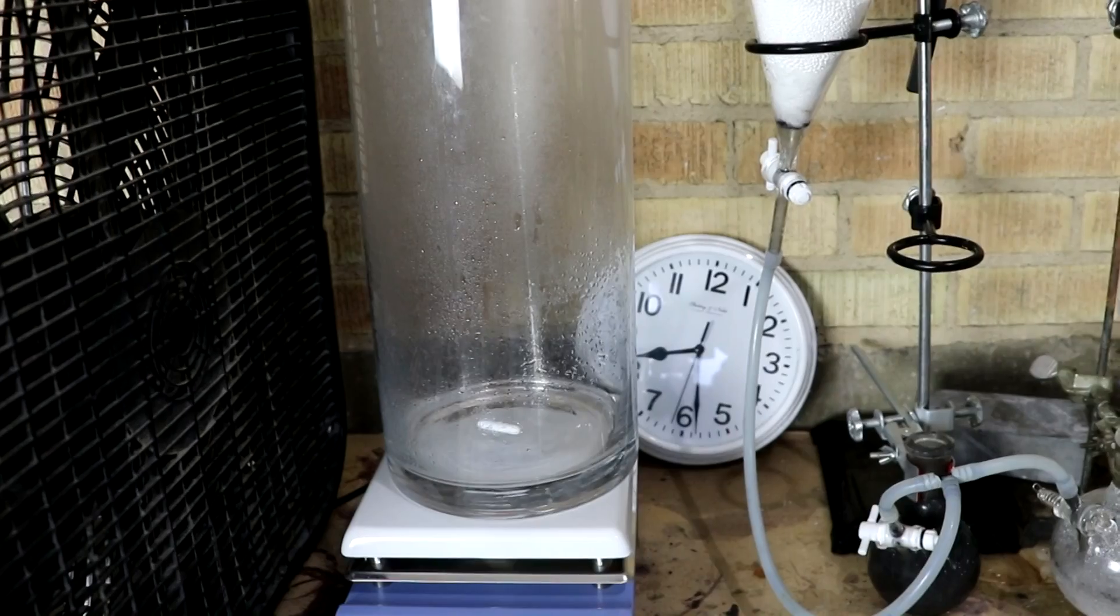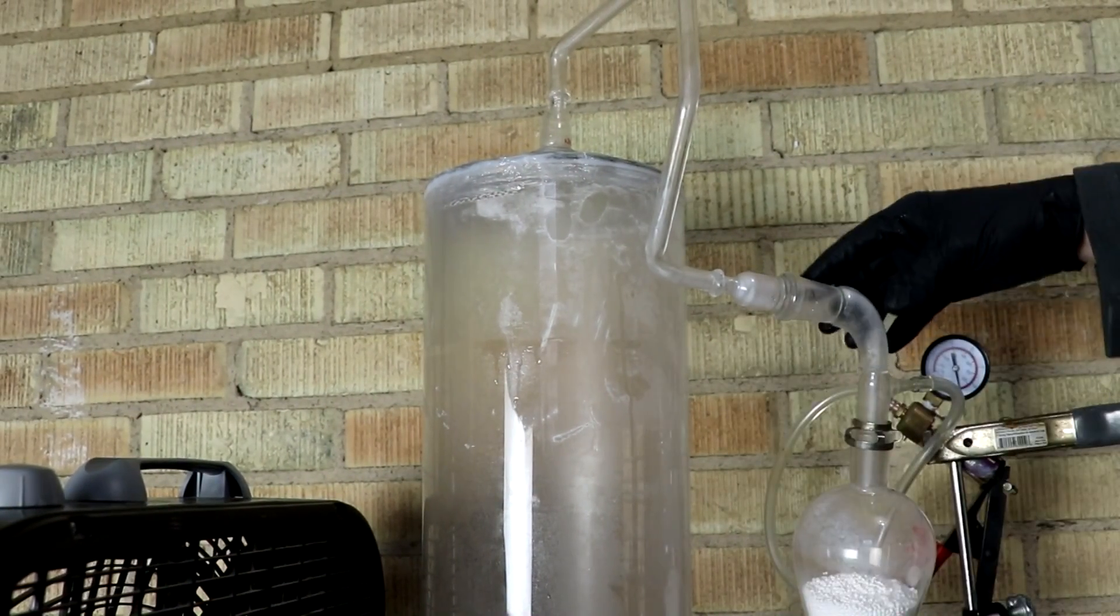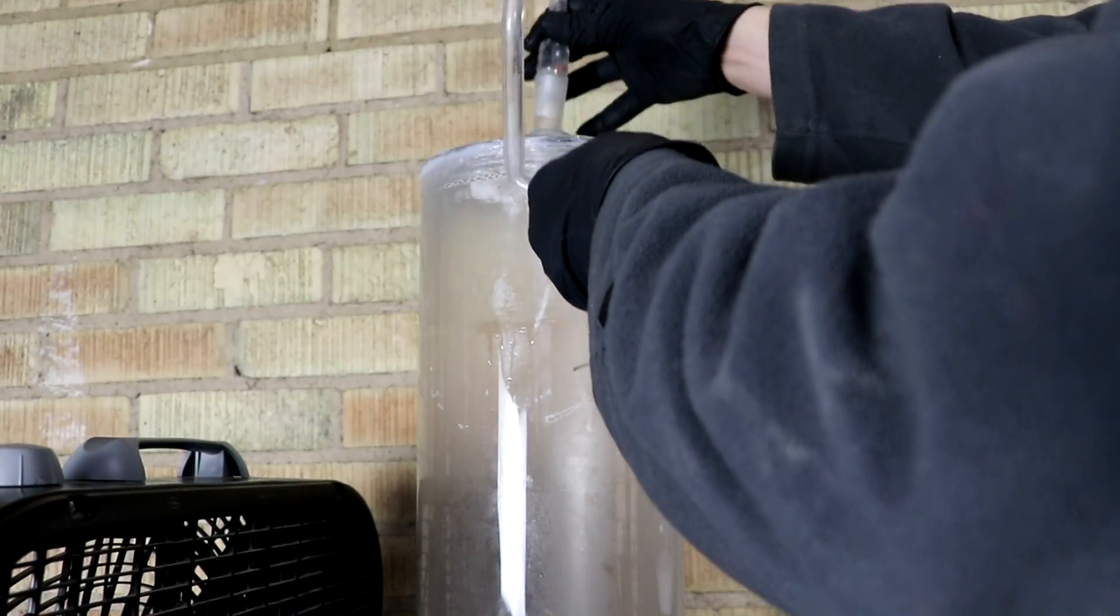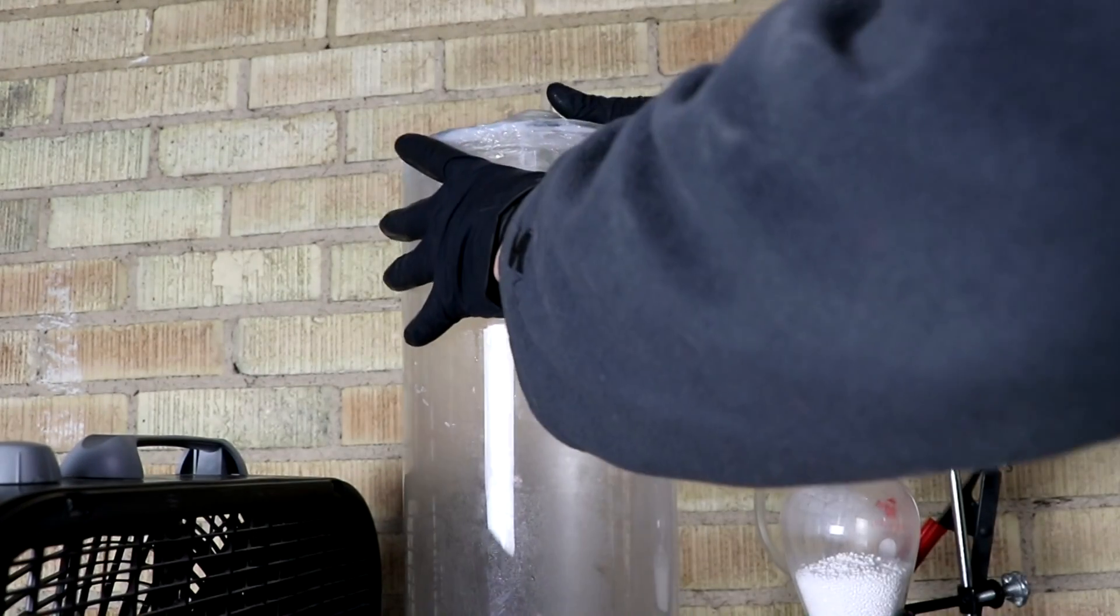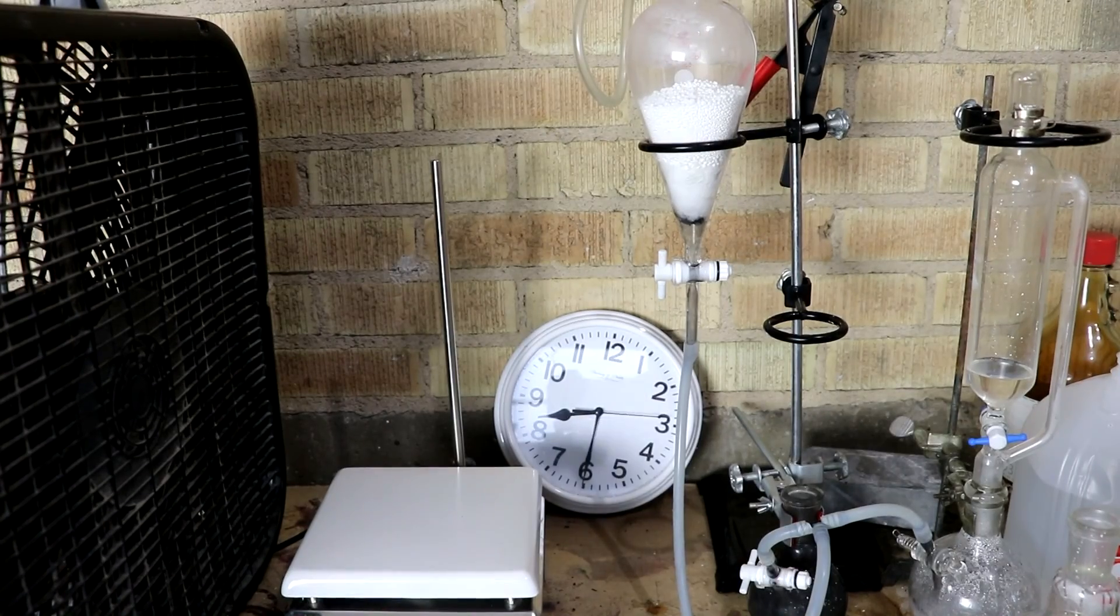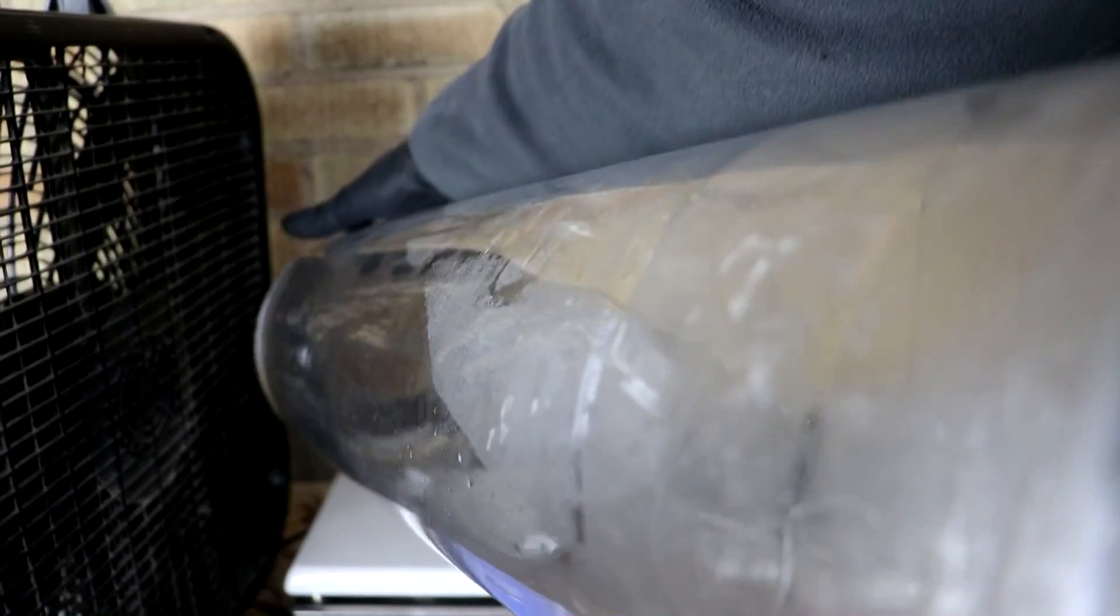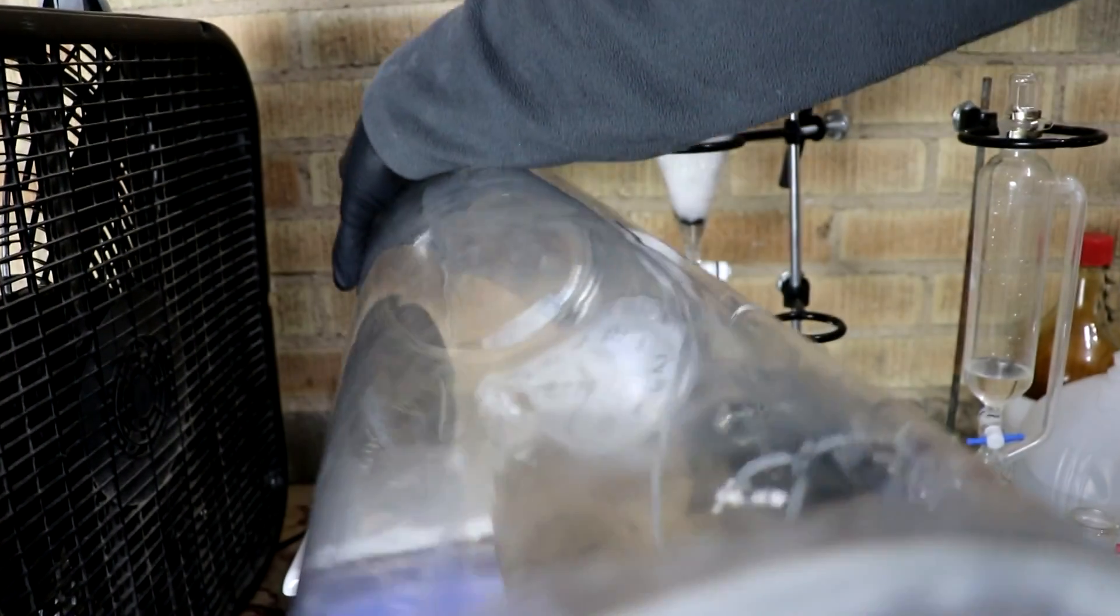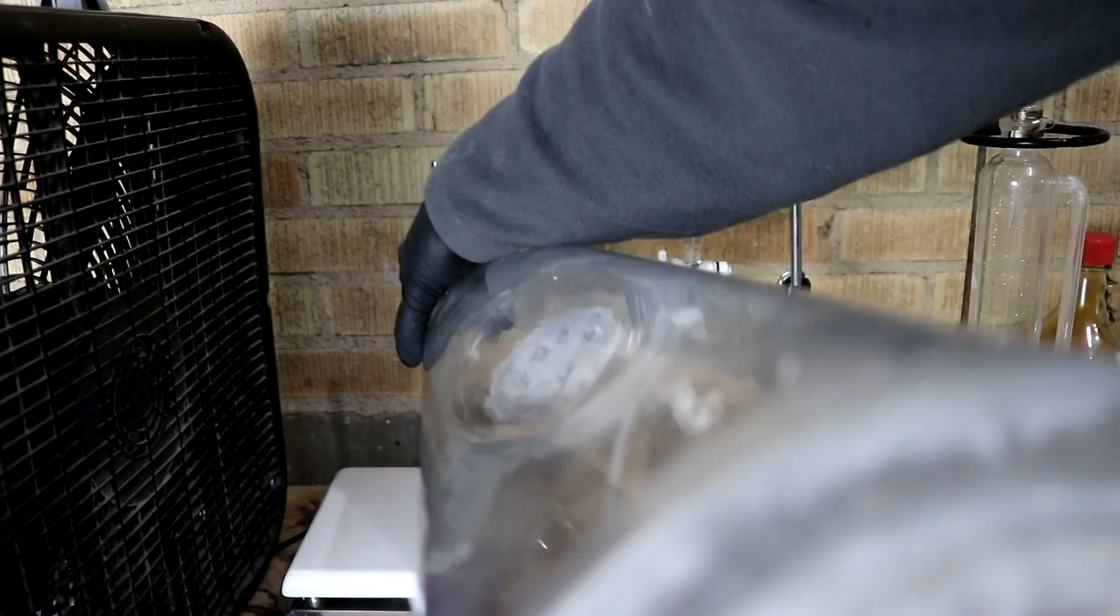So I actually let it go to about 8:30. Let's shut it down. Pop this off. Open it up. I smell a little bit of sulfur dioxide, so I didn't use up all of it. But it's weak enough that I think it must have used most of it. I'm going to shake this around, get all that off the walls of the chamber.